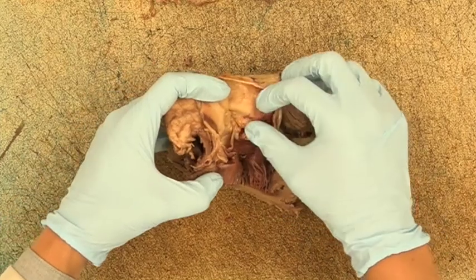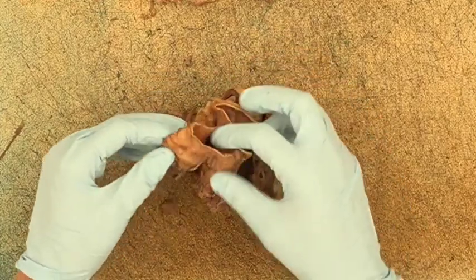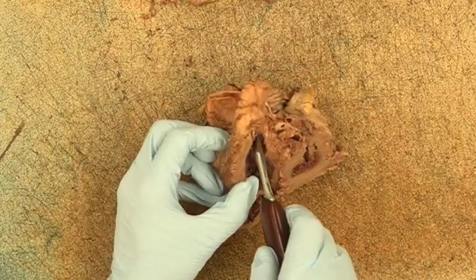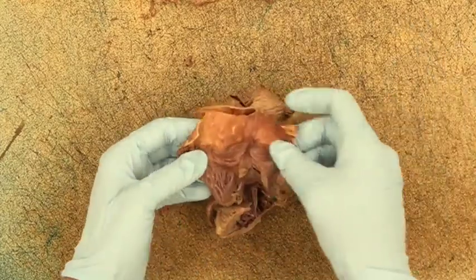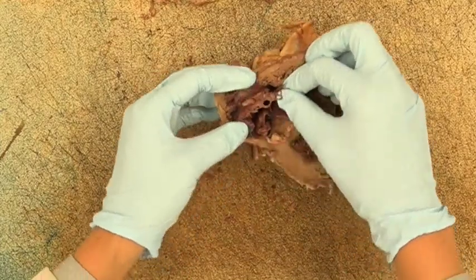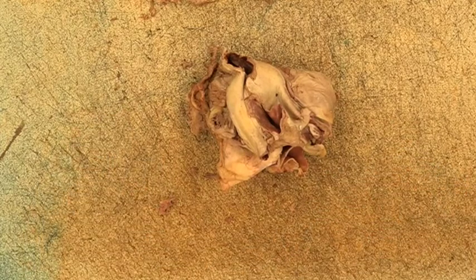This aortic valve and aorta has moderate calcification. But the pulmonary valve is normal. Use the laboratory guide to compare the valves of the heart from your cadaver to images of these pathologic incidences. In addition, etiology and clinical background information is provided in the guide for each condition.